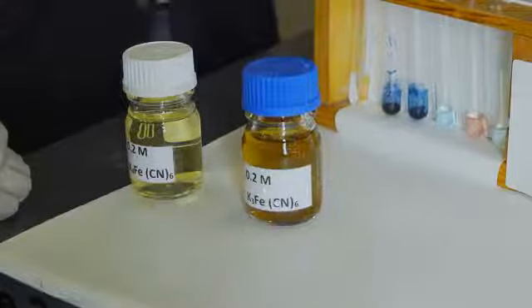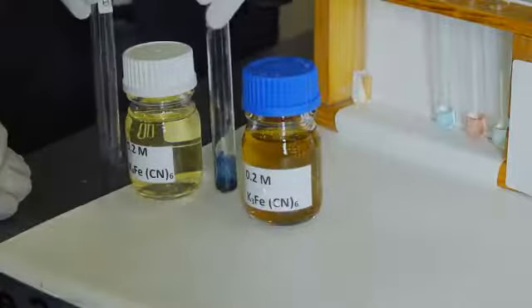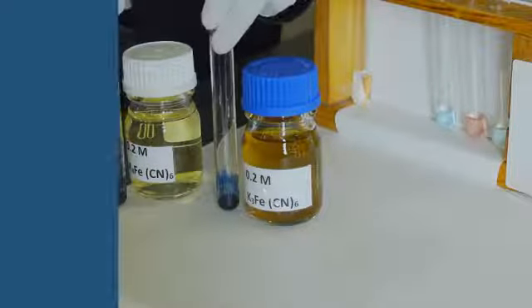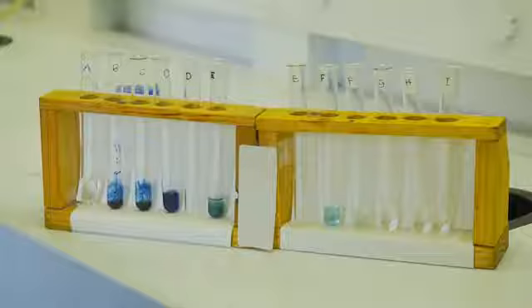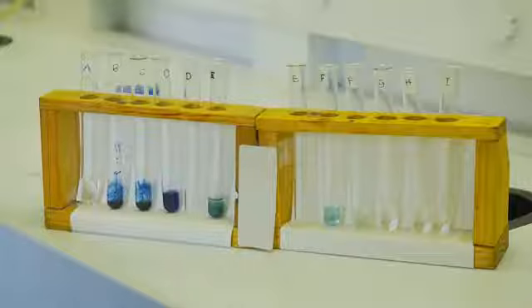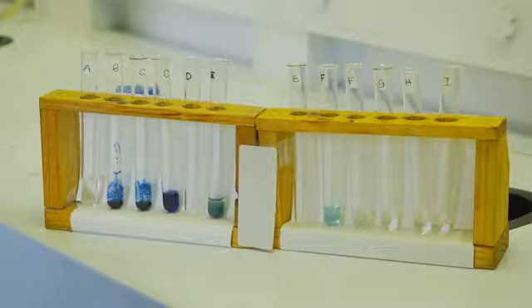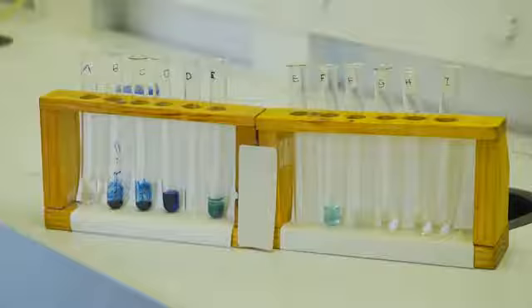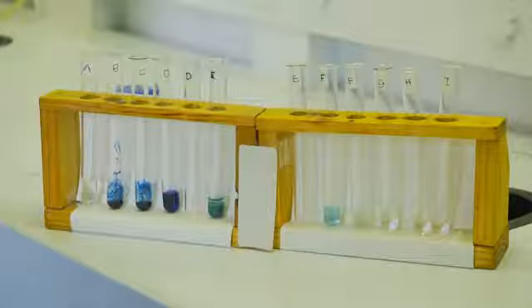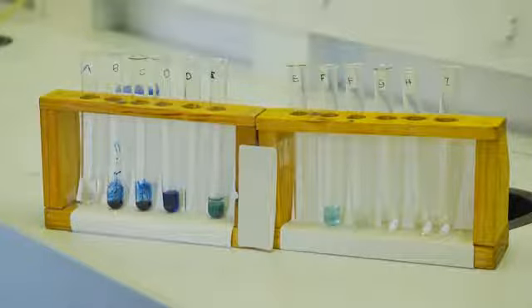Both reactions do give a blue color solution. Note that all experiments involving the use of ethylenediamine must be done in the fume hood, because ethylenediamine does produce fumes.